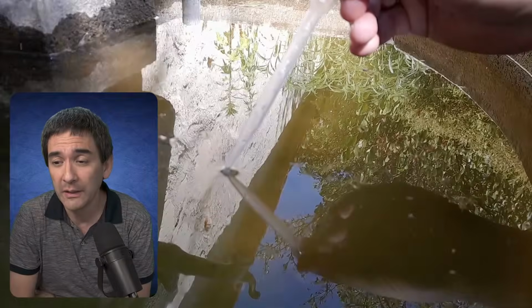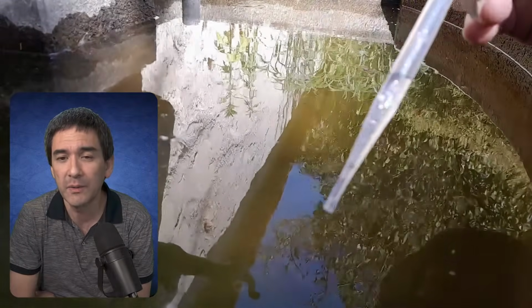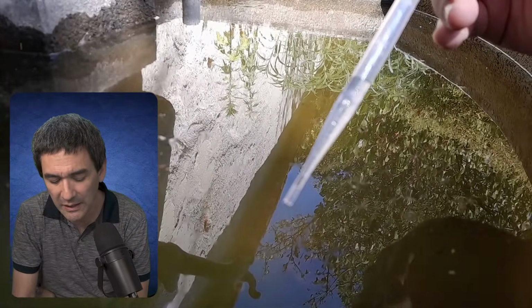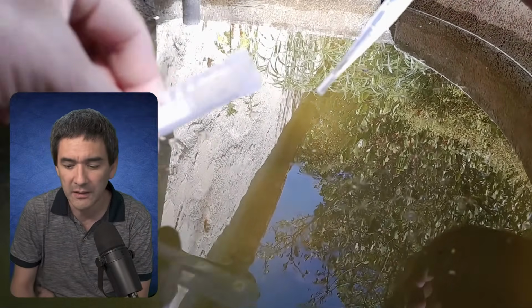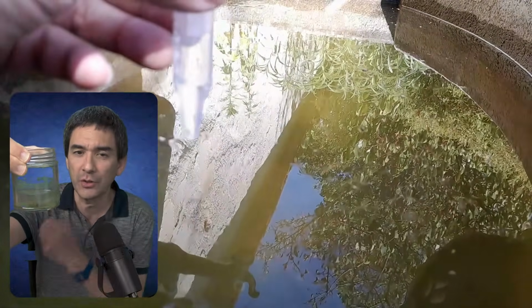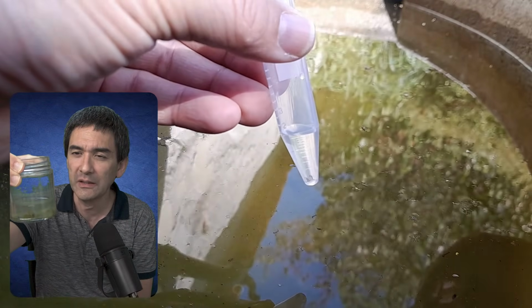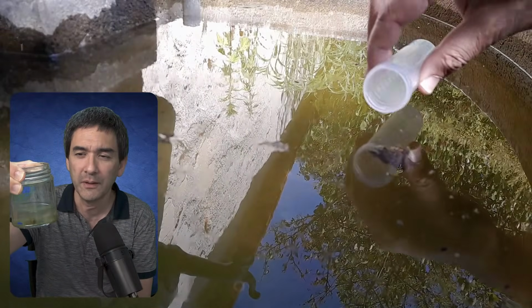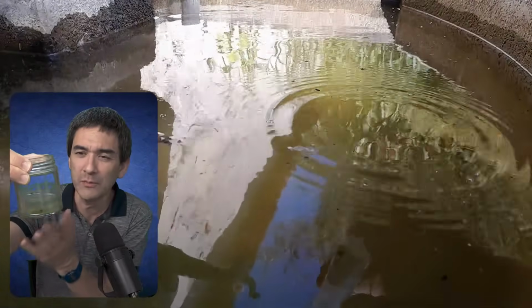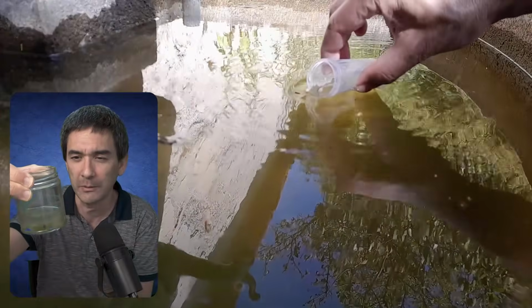However, what I've also found is that sometimes you have to wait a little bit. In my case over here, I added a little bit of wheat grain into the jar, and after a couple of days, certain algae just exploded and started to multiply. So this is not only a question of water balance, but maybe even a little bit of luck, which organisms were present in the first place, and if you are able to create the right conditions for them to multiply.